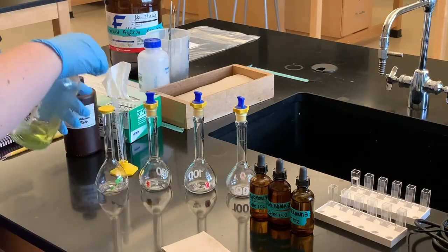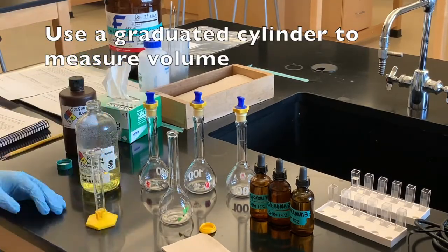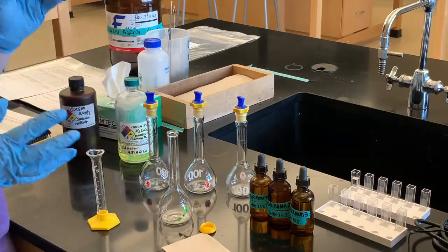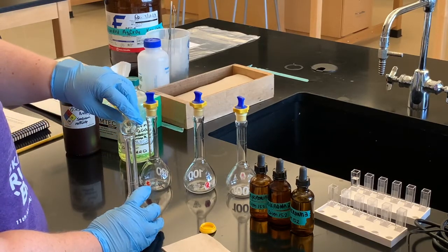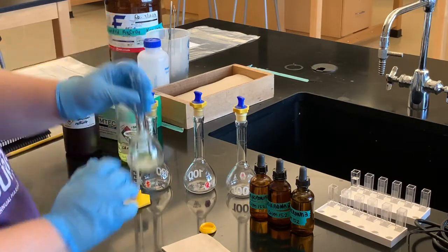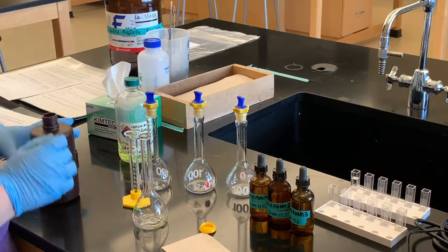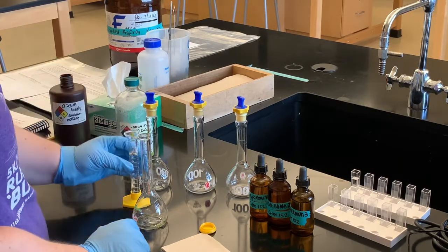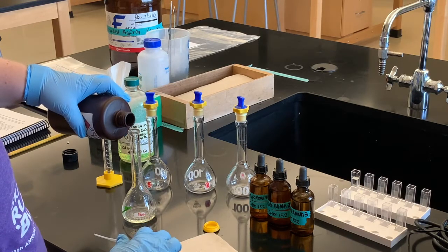We're going to use one milliliter of this potassium chromate. Remember, when you measure volumes you should use a graduated cylinder or a burette — we're using graduated cylinders today. I'm going to add that one milliliter here, and then rinse out the graduated cylinder with the sodium nitrate just to make sure we get all of that potassium chromate out, then fill up the solution with the rest of the sodium nitrate.